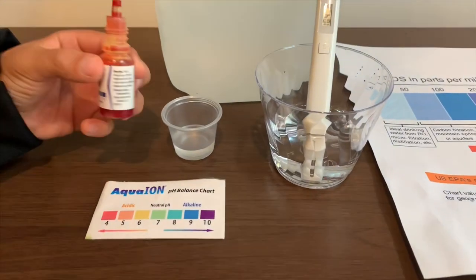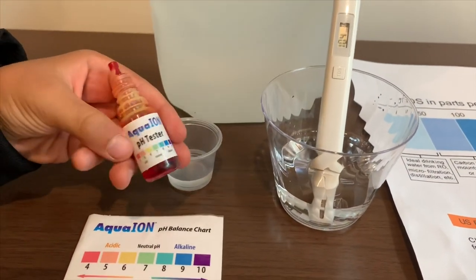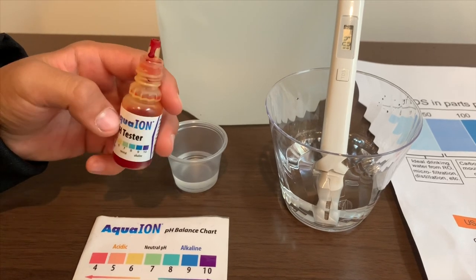Now let's test the pH level. If you want to buy this pH tester, check the link down below.